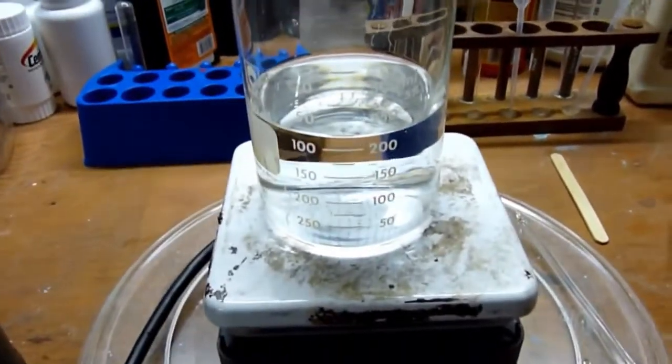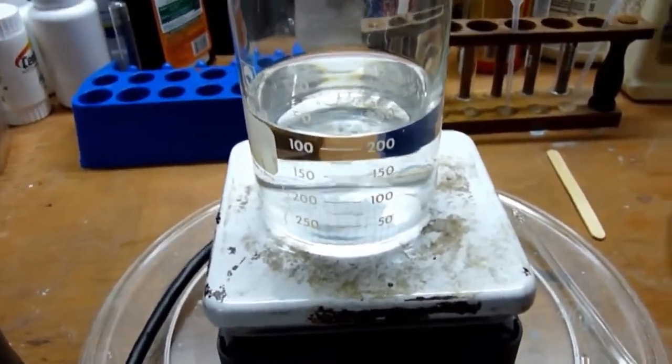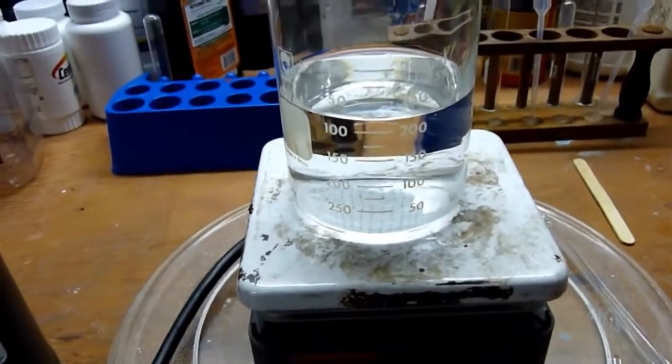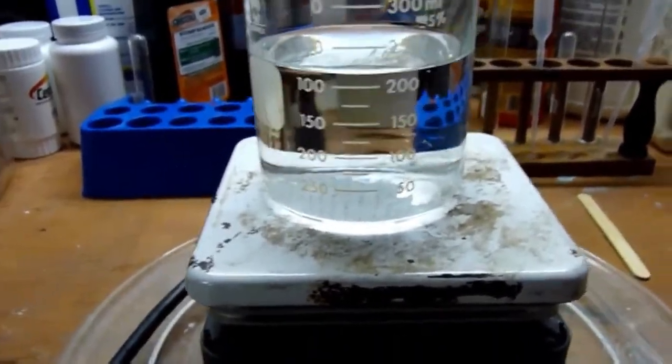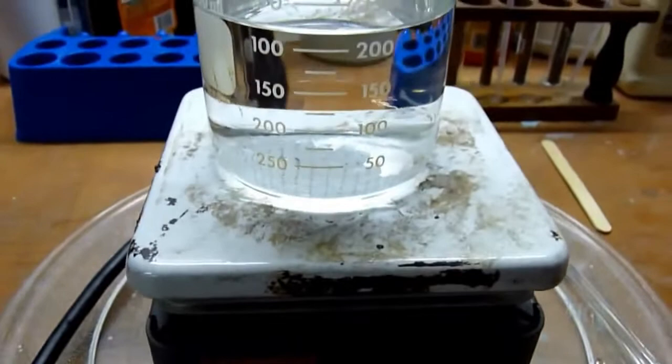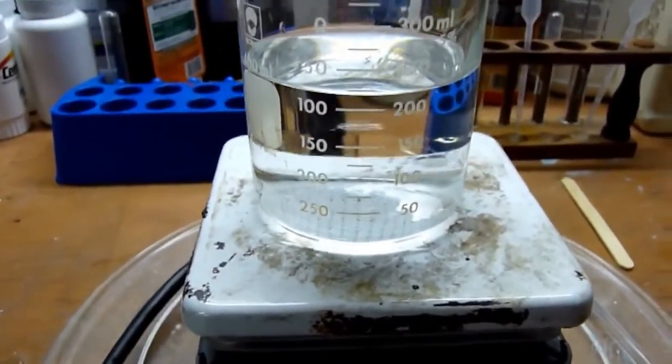And of course, if your beaker's not clean, you're going to get a lot of decomposition. So, I hope we come back when this is steaming like it should be, and I'll show you that process. And then the finished product we'll do some tests on. So, until then.